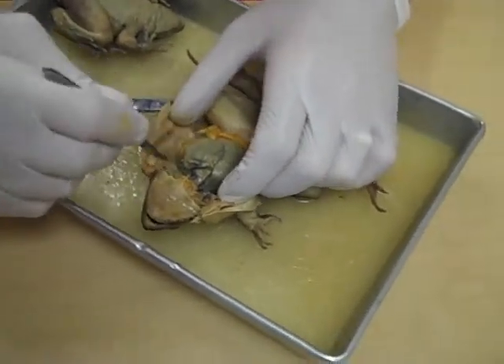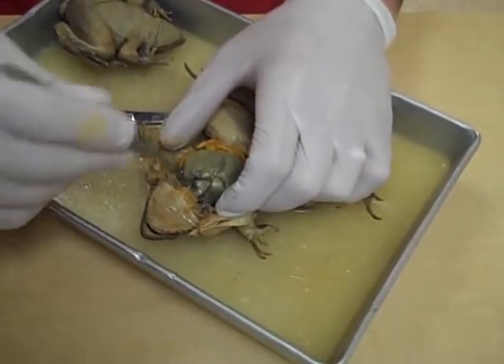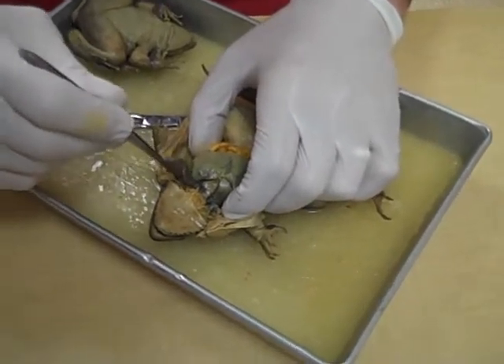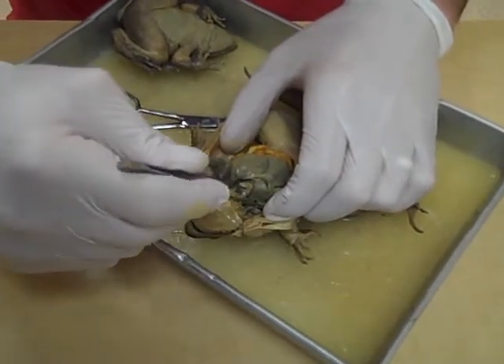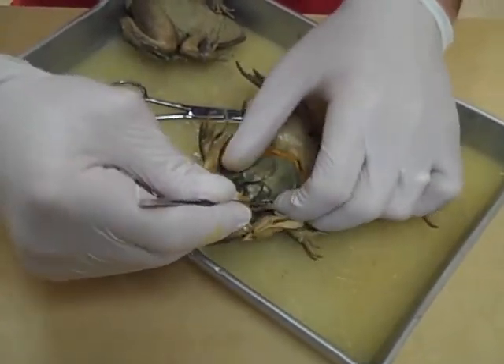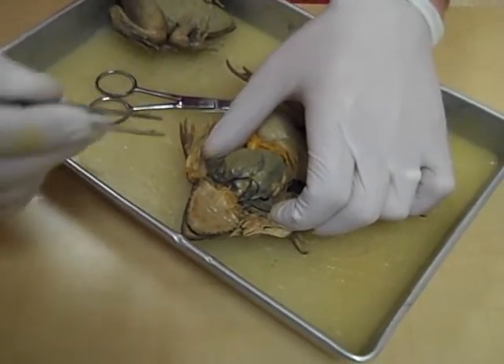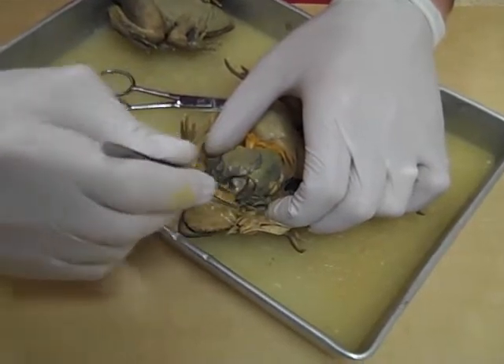Now, what's associated with the heart? The heart is there to re-oxygenate blood, and we need lungs for that. So on either side we have a lung. There's a lung on the frog's left side, and if we dig over here we can pull out the right lung. And there's your lungs — they're pretty cool to look at and to prod a little bit. The tissue is different than most of the other tissue inside the frog. So, lungs and heart.